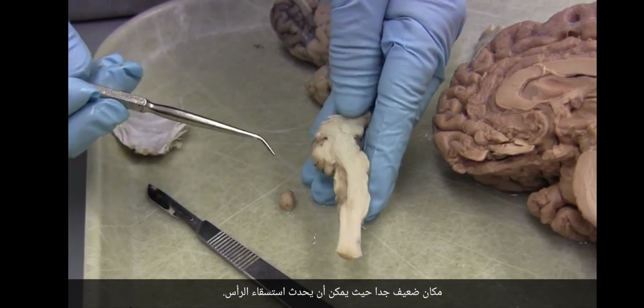Okay, now the final thing that I want to do is explain to you about the ventricles. That's what we'll do next.